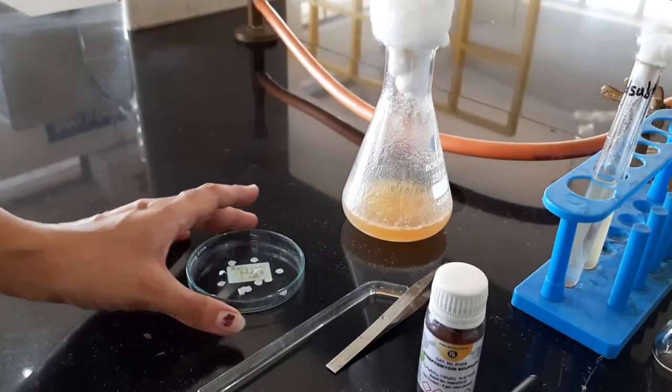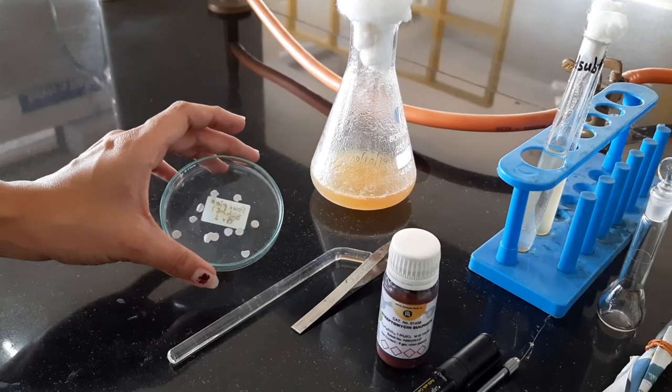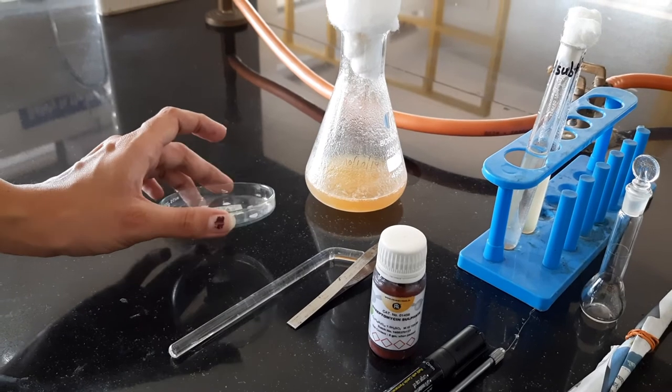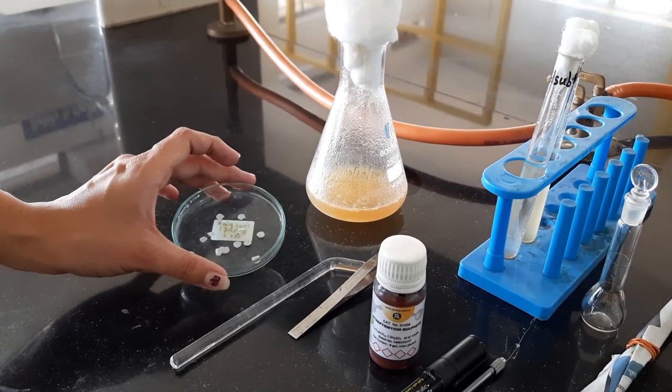In addition to this, we require filter discs which will be placed on the agar medium for the disc diffusion method.